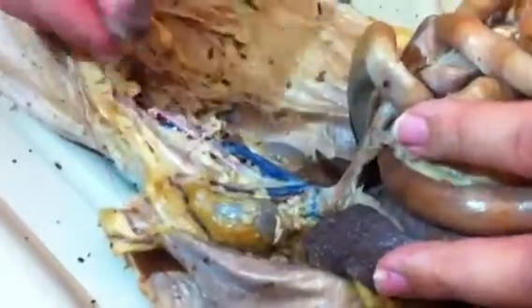And then we have to get the uterus out of the way. This is the uterus, the little Y, the little leg. And this is the ovary. So if I poke the ovary, what hormones come from the ovary? Estrogen and progesterone. So there's the ovary. We'll hang her over the edge.